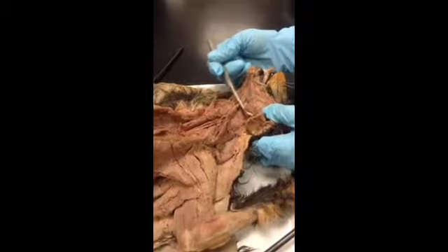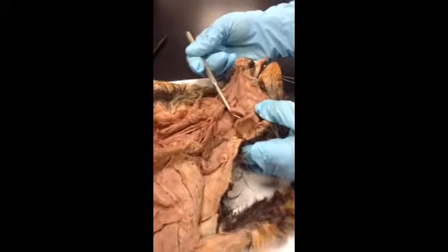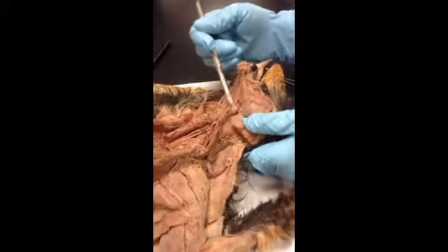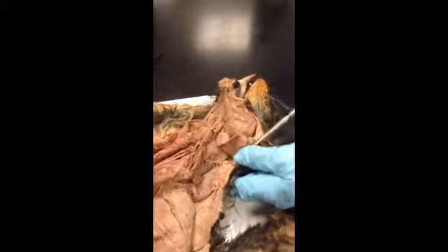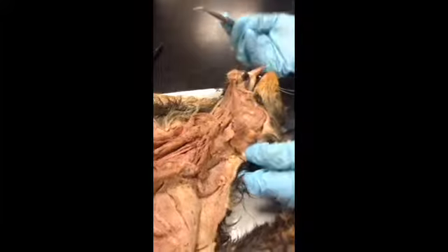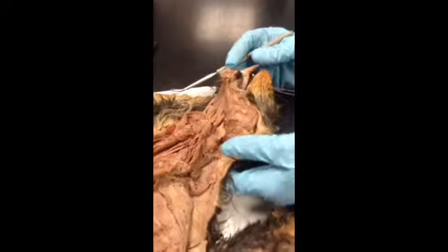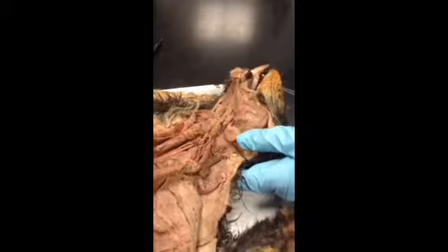This little flapper, that's the submandibular gland. And we can actually still see the duct for that is intact right here. Okay? Usually your parotid gland is here and your parotid duct runs across that masseter muscle into the back of the mouth, but that doesn't seem to be here anymore. Okay, and then the third set are the sublinguals, but they're deep in there. They're not going to ask you for them. Okay?